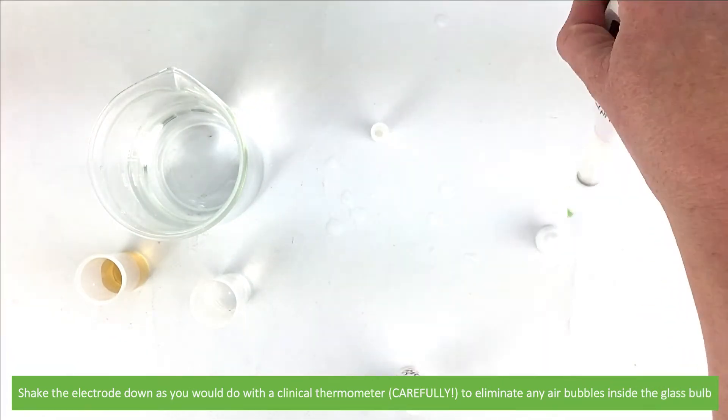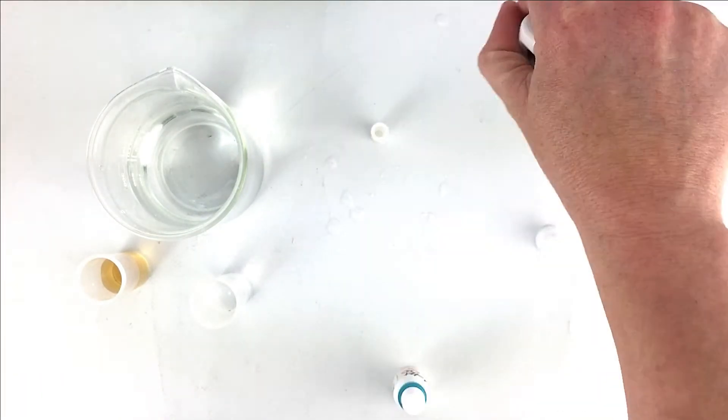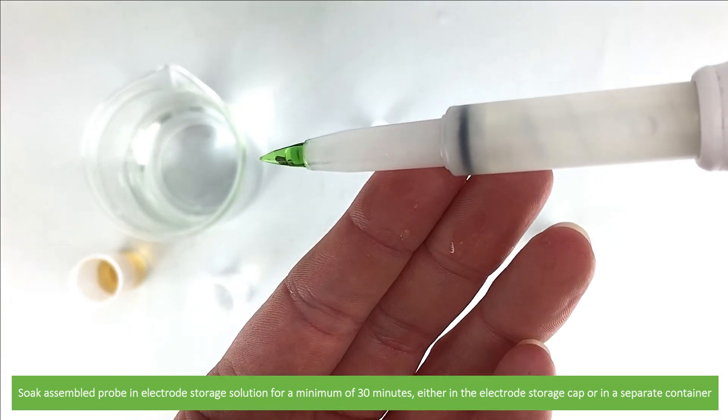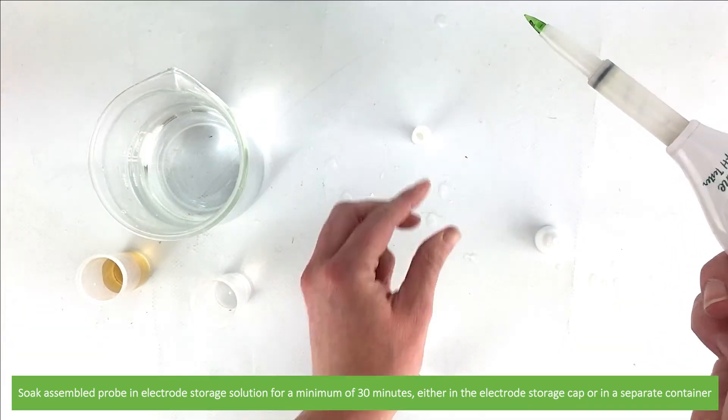Then soak the assembled probe in electrode storage solution for a minimum of 30 minutes. You can do this either in the electrode storage cap or in a separate container.